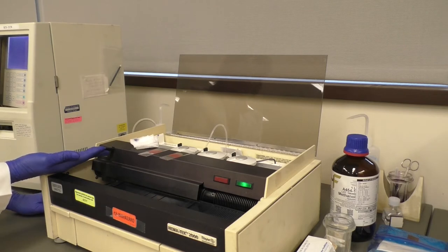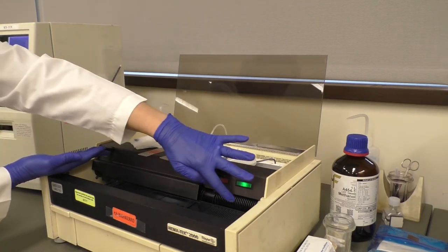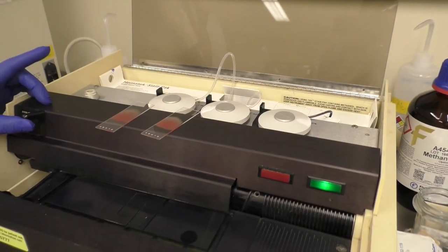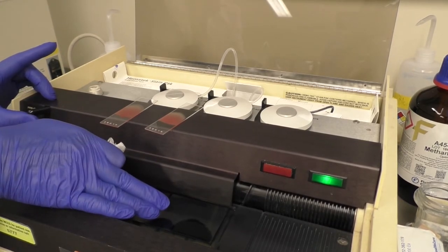The instrument on signal light will go on and the conveyor spirals will begin to revolve. When solutions flow onto the platen, release the lever.